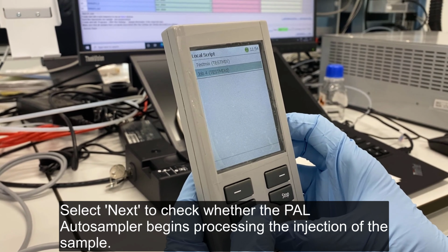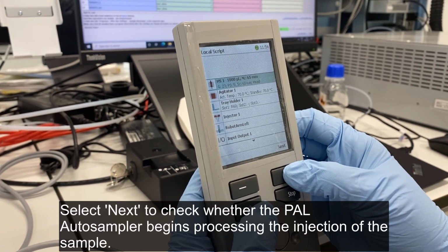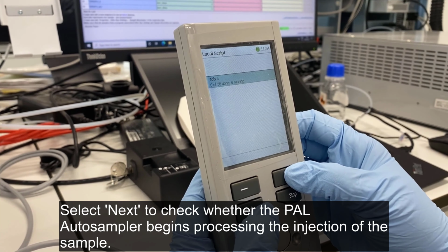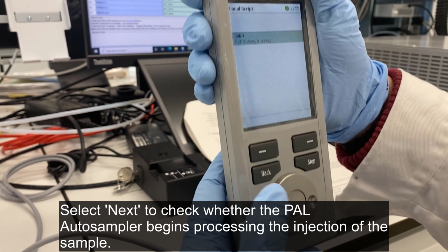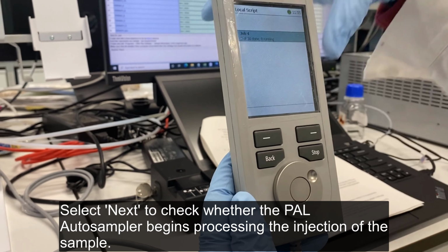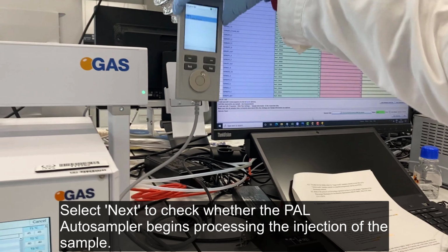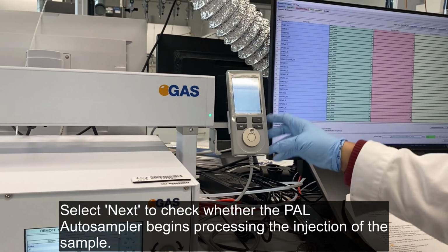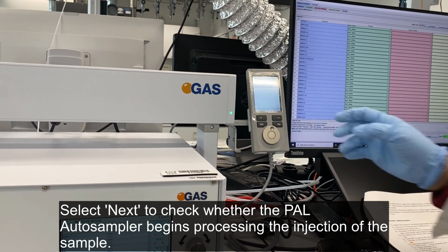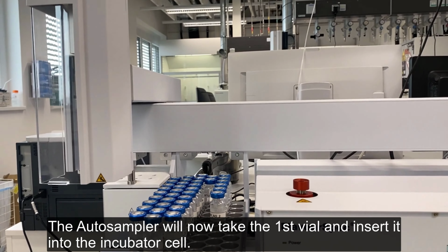Select Next to check whether the PAL auto-sampler begins processing the injection of the sample. The auto-sampler will now take the first vial and insert it into the incubator cell.